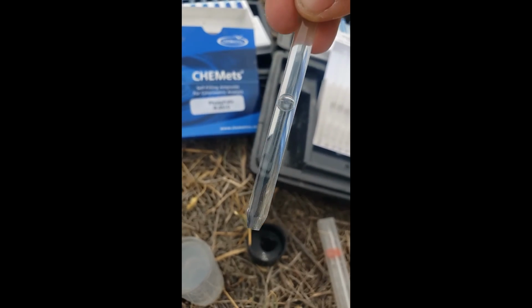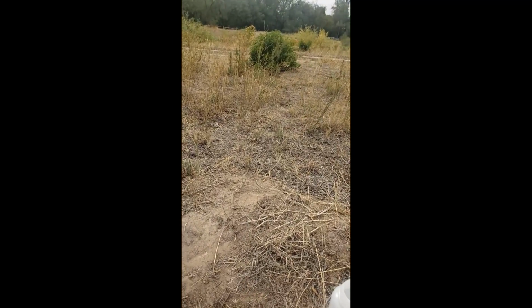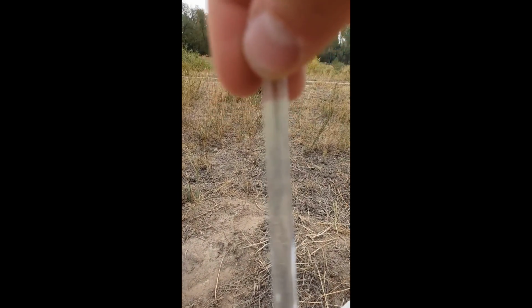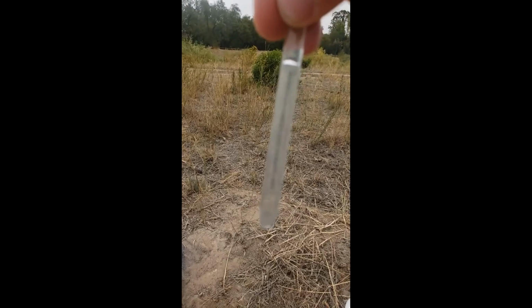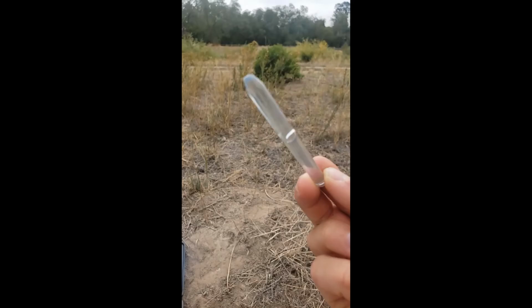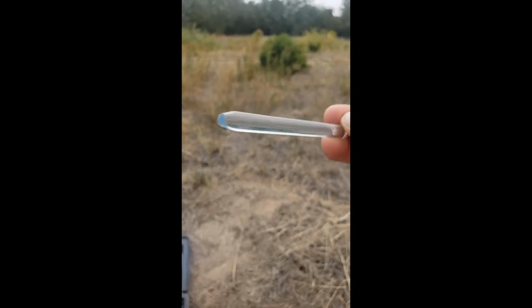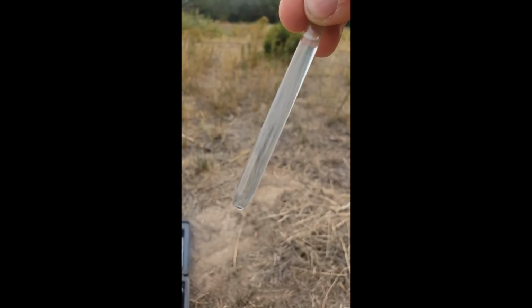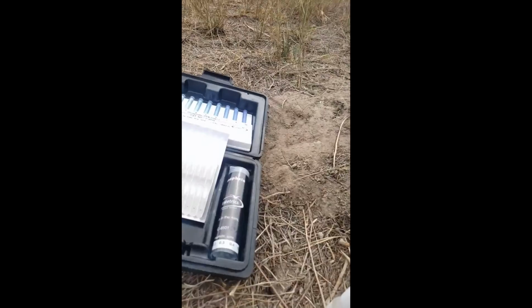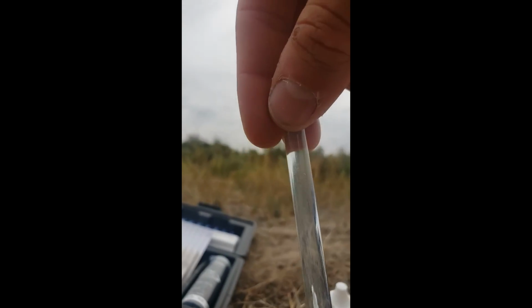Okay, and then from here, let's see, I don't really detect a color change, which is maybe okay. What we're going to measure this against is some solutions that have already been made with different levels of phosphorus to see what is the actual level of phosphorus in our sample. Okay, so that's where I'm going to take, let's see, does this work with the camera?